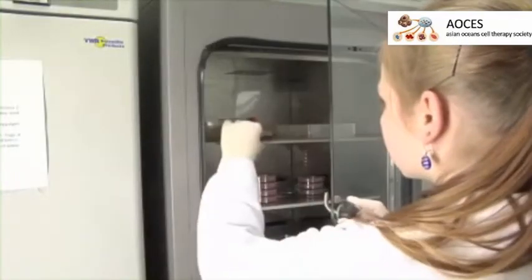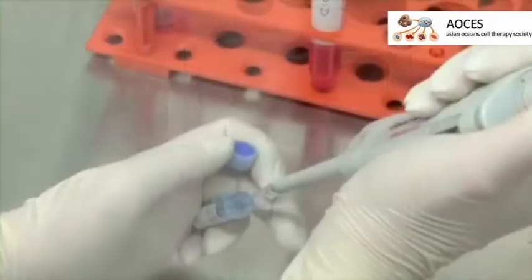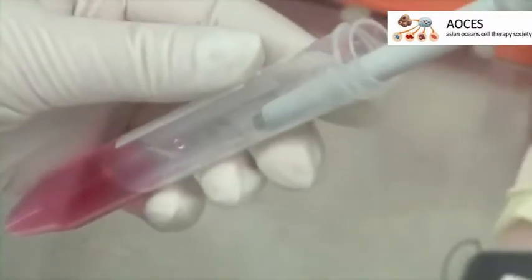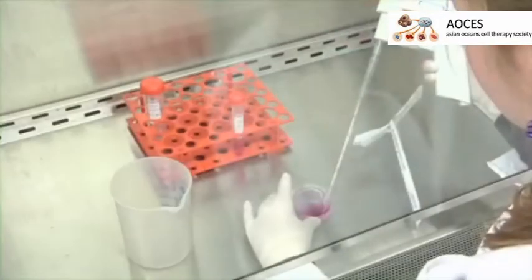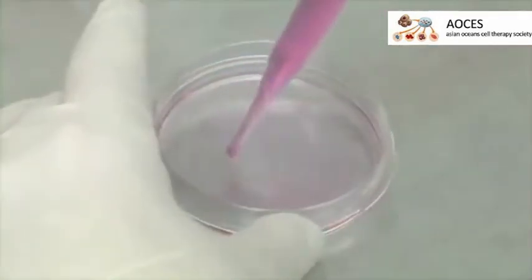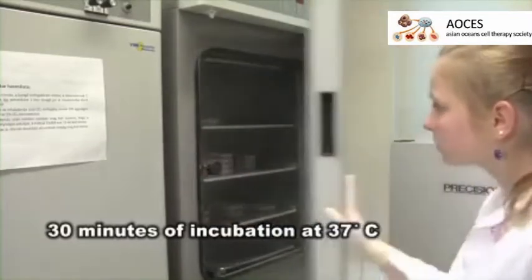During simulated ischemia, prepare rescue cells for transplantation. Dilute the fluorescent dye Vybrant DiD in a 1 to 200 ratio in DMEM culture medium. Aspirate medium from the rescue cells and add 300 microliters DMEM with Vybrant. Place petri dishes for 30 minutes in the 37-degree carbon dioxide incubator.